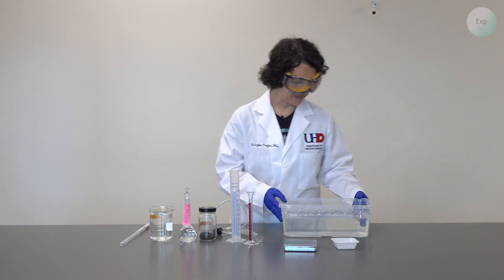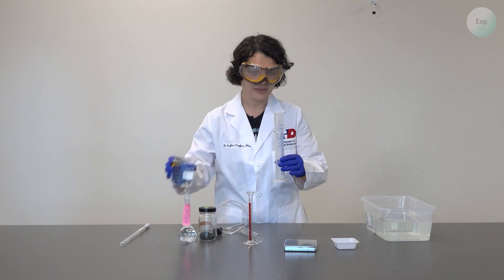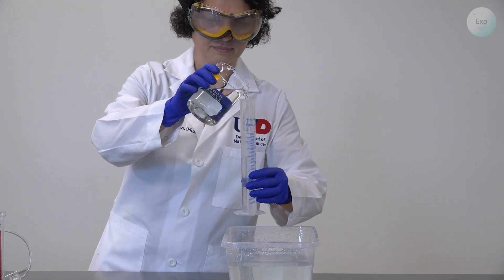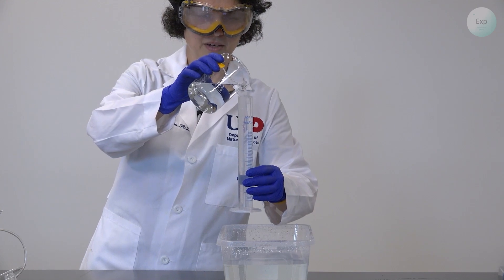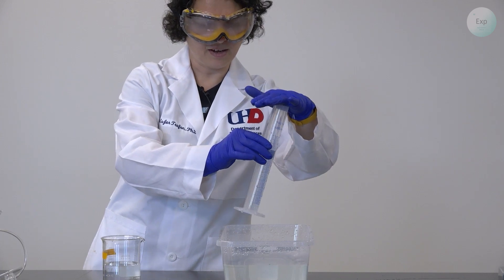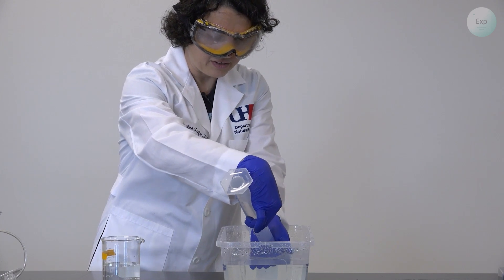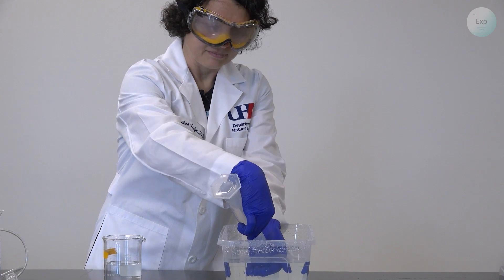So let's begin our experiment. First, we are going to take our 100 milliliter graduated cylinder and fill it up all the way with water. I'm doing this on top of the tub of water because if any drips over, it will be caught. Then I'm going to take my hand, place it right on top of the graduated cylinder, hold it down, turn it upside down, and then slide my hand under the water so that when I release it, hopefully there will be no air bubbles.